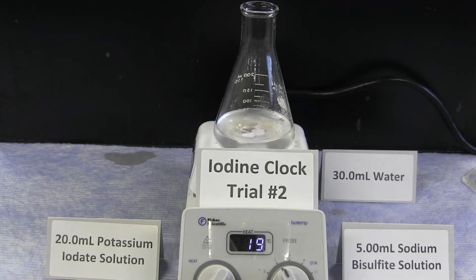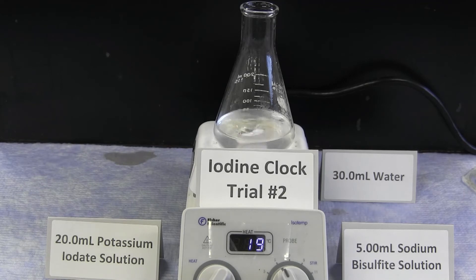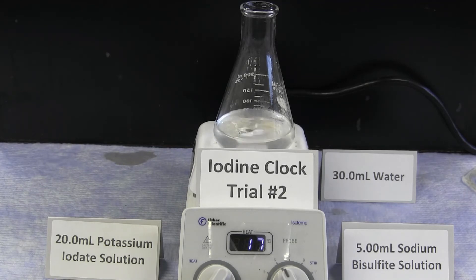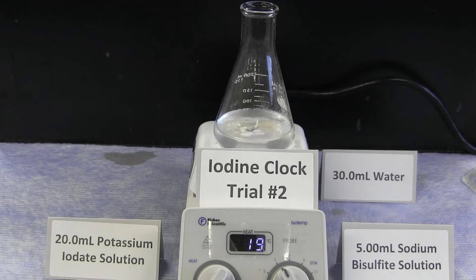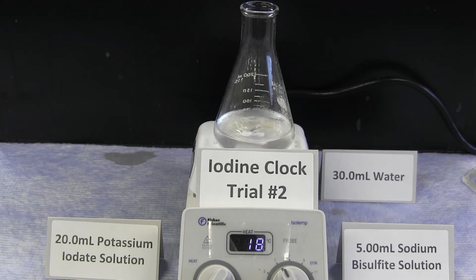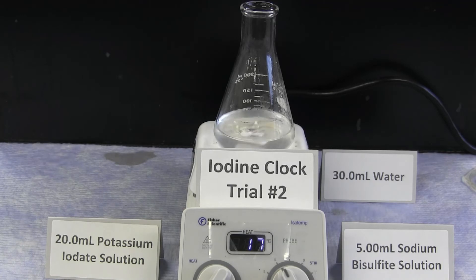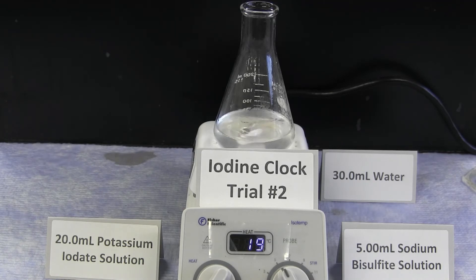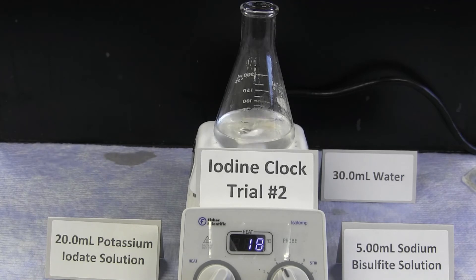You'll notice by this stage that as the concentration is being decreased in a linear fashion, the time is increasing in a non-linear rate. This is due to the logarithmic relationship between reaction time and concentration.